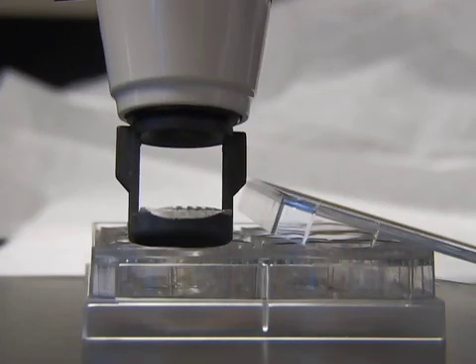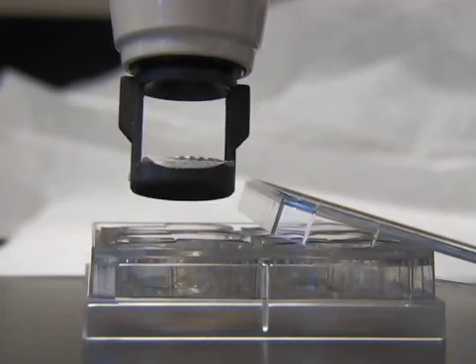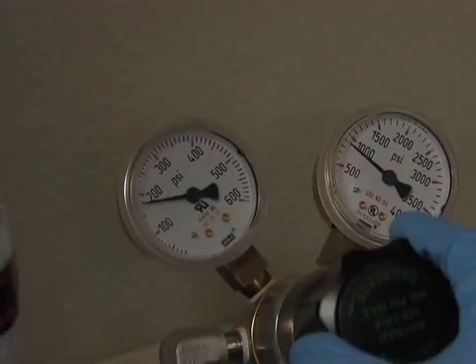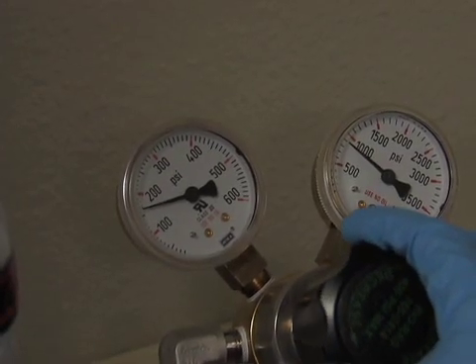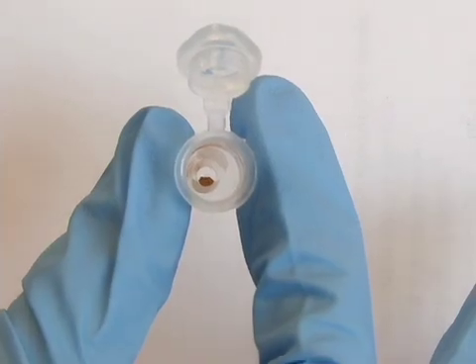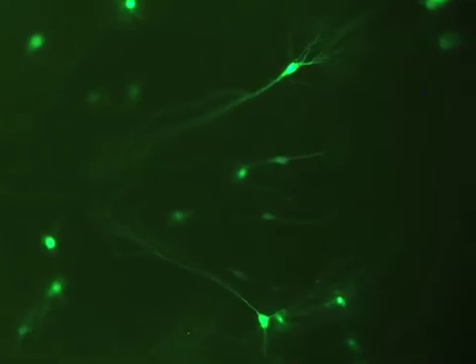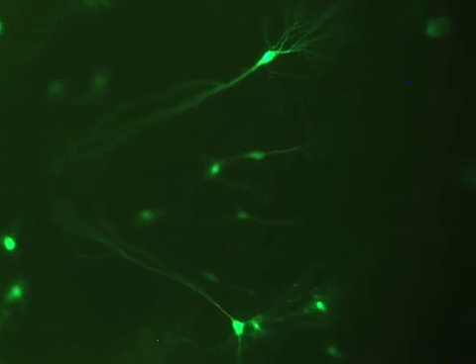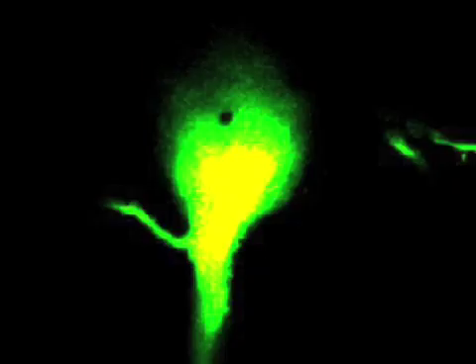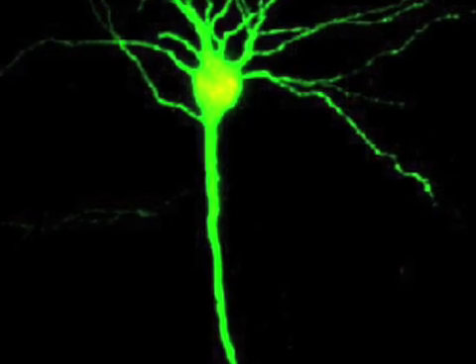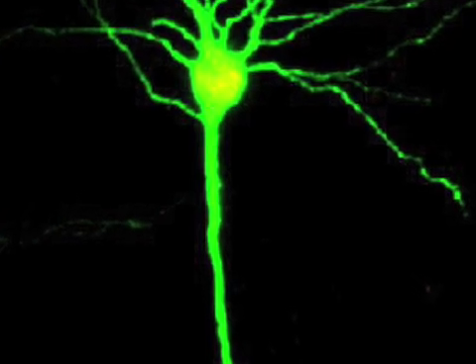If too many cells are transfected, try increasing the shooting distance from the sample, or decreasing the shooting pressure, or decreasing the amount of gold for making the bullets. Here you can see a great example of transfected CA1 pyramidal neuron. On this particular cell, we can see a gold bullet embedded into the cell. Here's a closer look at a transfected neuron in CA1.